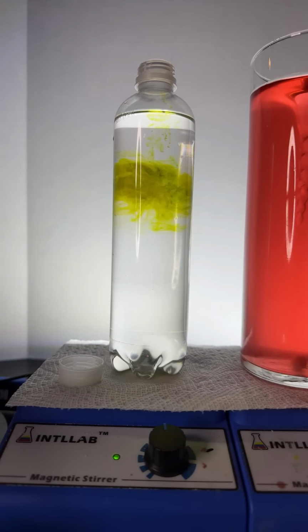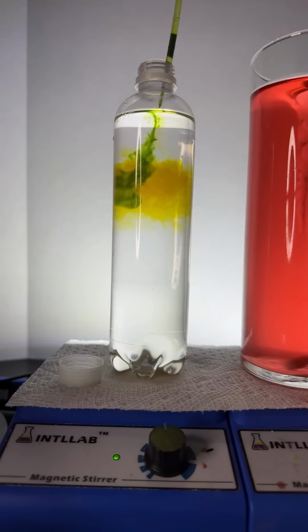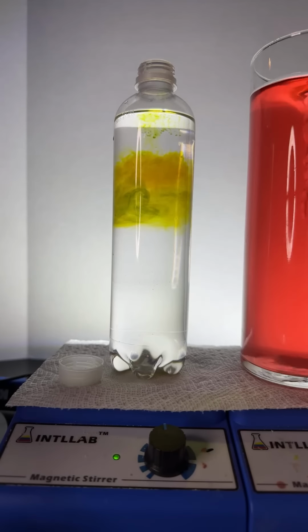It looks like it's stuck in the middle. Why in the world would that be stuck in the middle? Well, sorry about that. That's because, remember, at the top layer, there is alcohol. And at the bottom layer, there's water, and the two have not mixed.